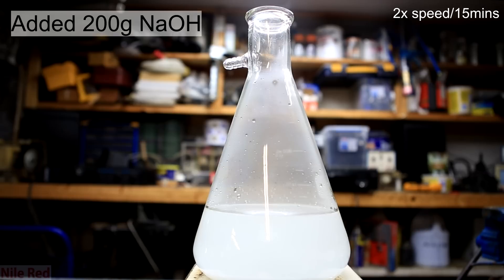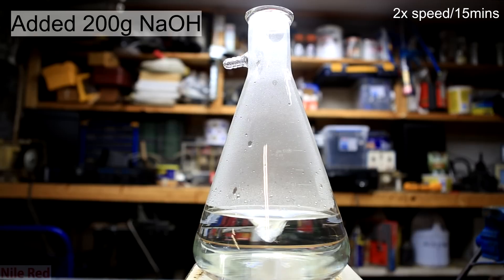The dissolution of sodium hydroxide in water is quite exothermic, so not only are we going to have to wait for the sodium hydroxide to dissolve, we're also going to have to wait for the solution to cool back down. We don't want to add hot sodium hydroxide solution to the isopropyl alcohol.